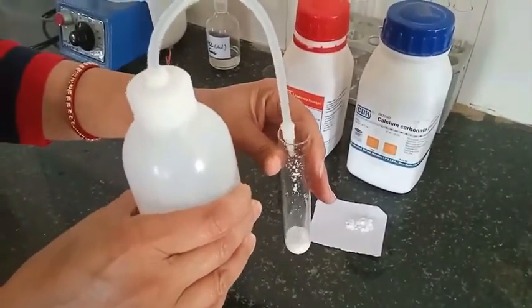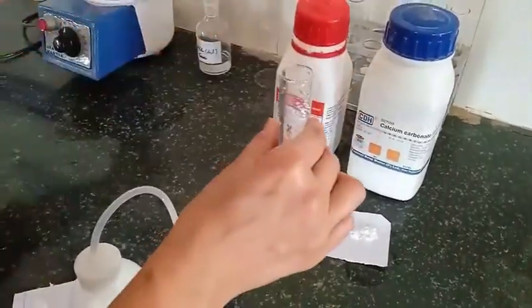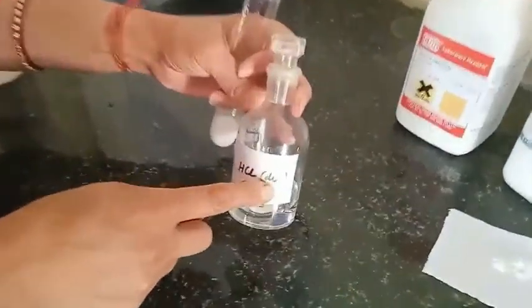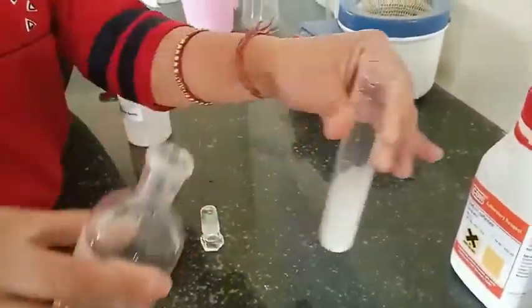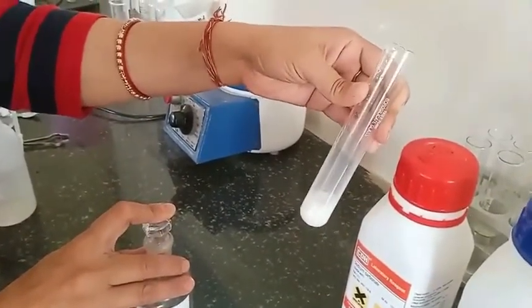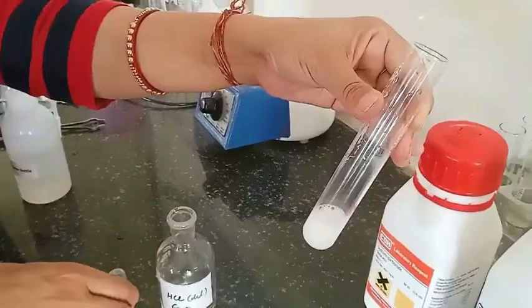Now I have taken calcium carbonate in another test tube and adding distilled water to it. It is insoluble in water even on heating. So to this calcium carbonate I am adding dilute HCl. As I told you earlier, if gas is evolved while preparing the original solution, then let it evolve. On heating also it is not clear, so we move further to prepare the clear solution. Original solution is now clear — from here onwards original solution is written as OS.